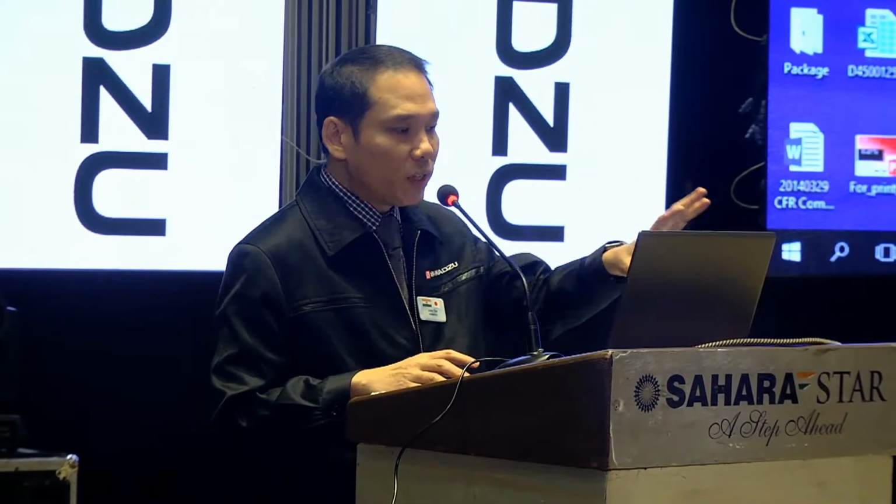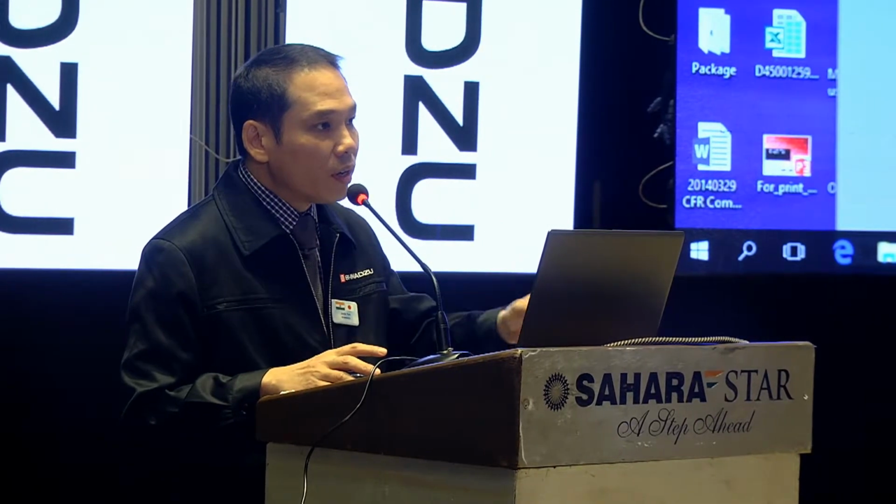So every time you use Lab Solution DB, any change you make to the software, you need to give a reason. So this will be logged inside the log files. So this creates an audit trail. So every year when the inspector comes, he can choose to inspect the audit trail. So now the reason I put: create permission for Sanjay.